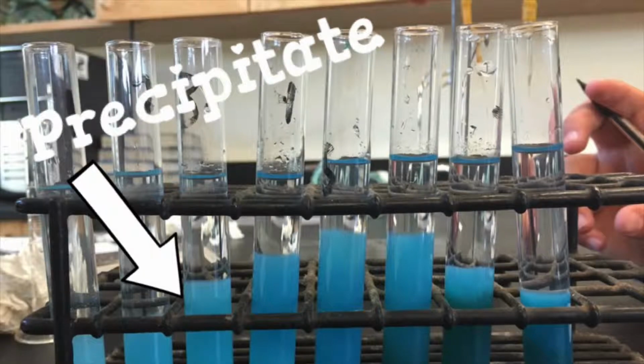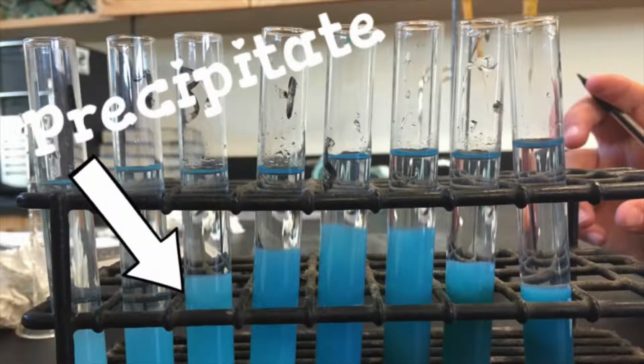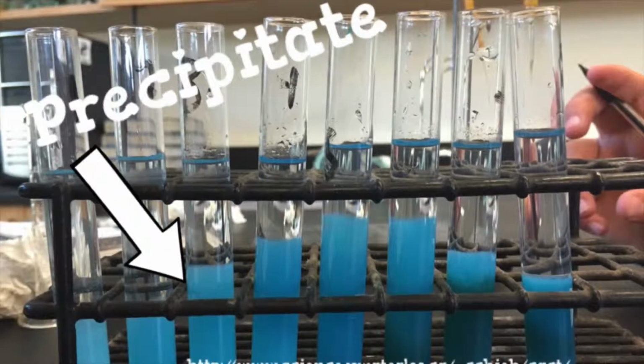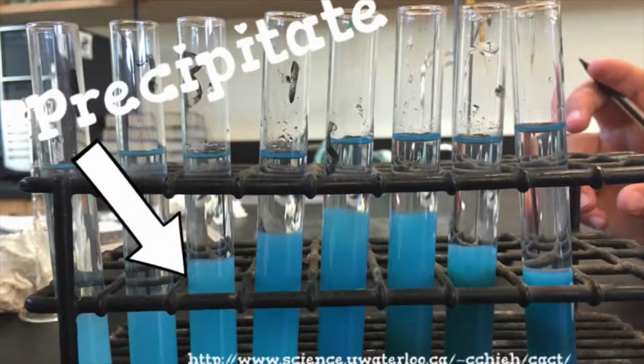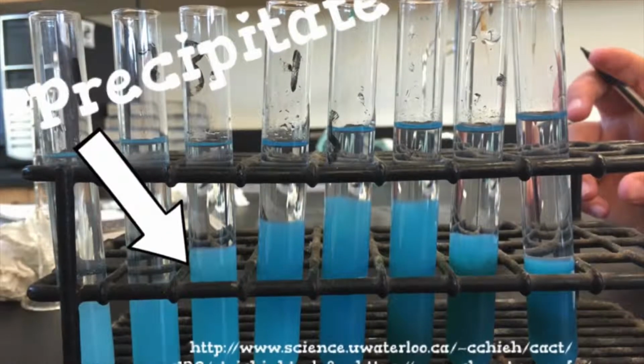The purpose of this lab is to figure out the limiting reactant within copper(II) sulfate and potassium hydroxide by investigating the amount of precipitate formed. For background knowledge, it is important to understand stoichiometry. The website below helped us understand that stoichiometry is the study of a quantitative relationship among reactants and products.